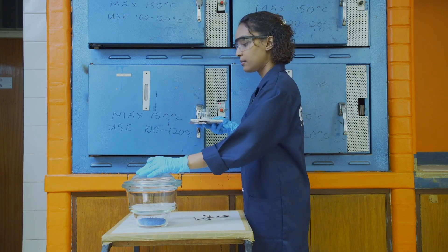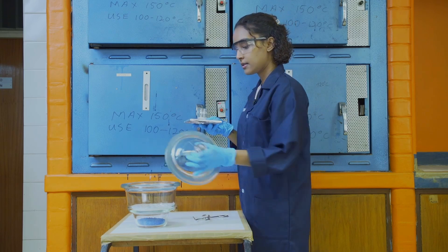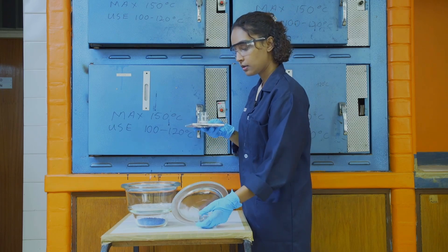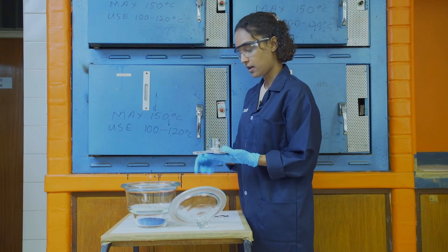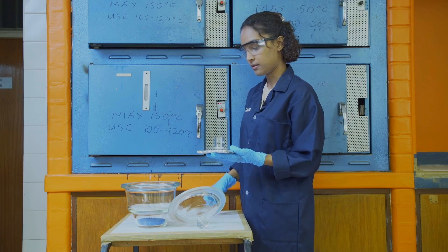You can then place this in a desiccator to cool, and once it has cooled, you can then weigh it in the balance room.